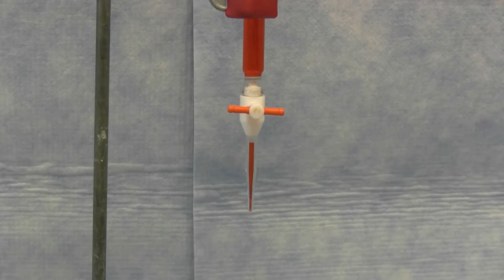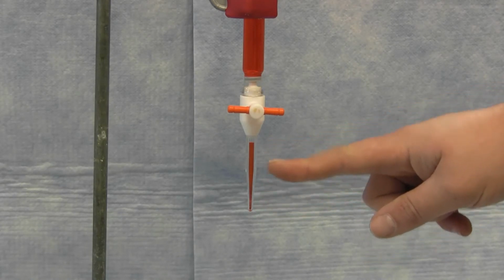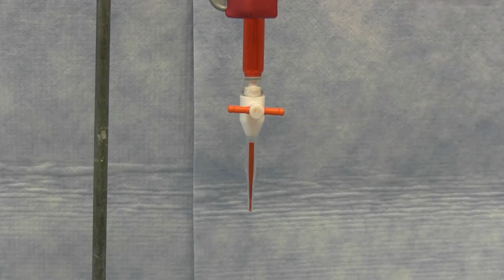You can see that by draining a little bit from the burette first to make it read 0, the tip of the burette is now also filled with liquid. The burette is calibrated to deliver a precise amount of volume, assuming the tip of the burette is already full. By doing so, now you're ready to use the burette to distribute your solution.